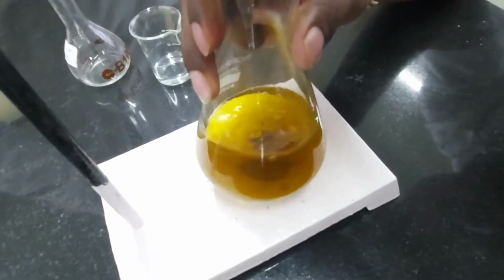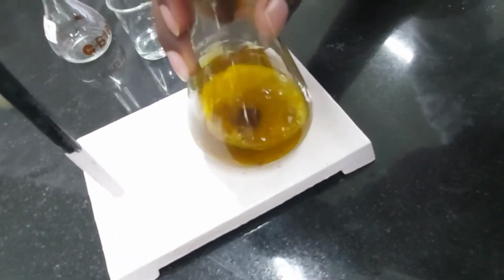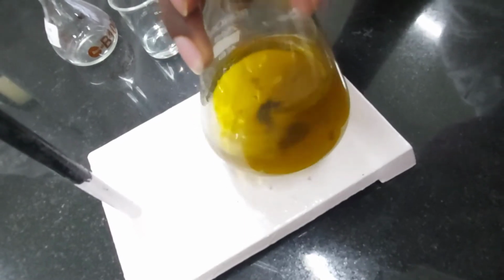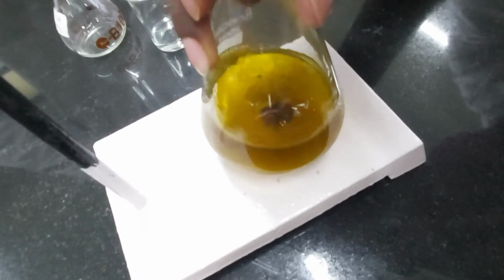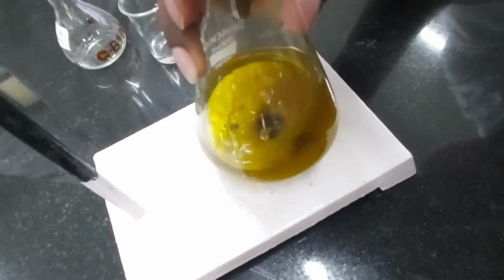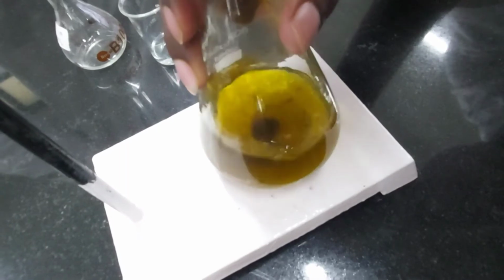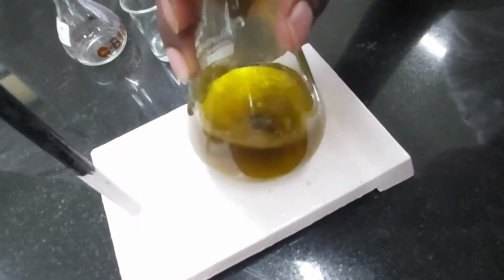Okay, it is now going towards green. Can you see that? The change in color from yellow-orange to green. Yes, it's becoming dark. That's a very nice green shade that you get just before the transition. That's a beautiful color. But slowly but surely the yellow color is disappearing. Yeah, my yellow-orange shade is going away.